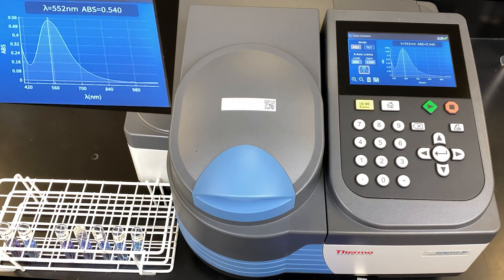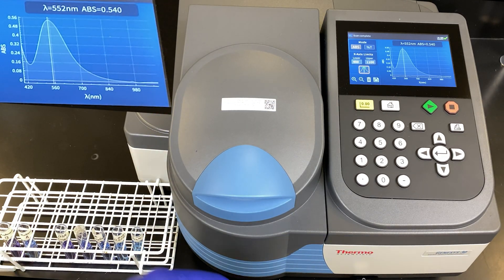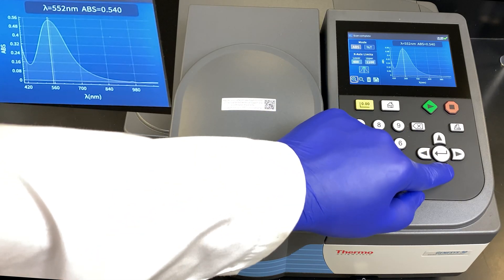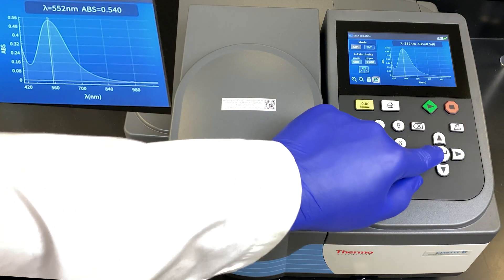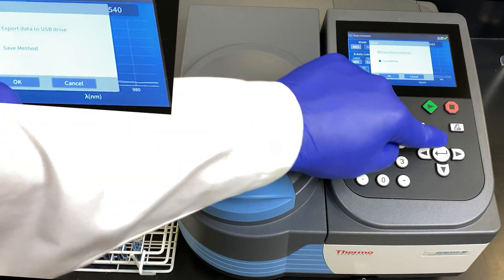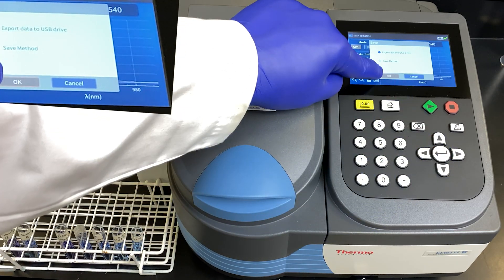If you want to, you can offload that data every point onto a USB drive. Select the save button with the cursor. Select transfer to USB. And then press OK.